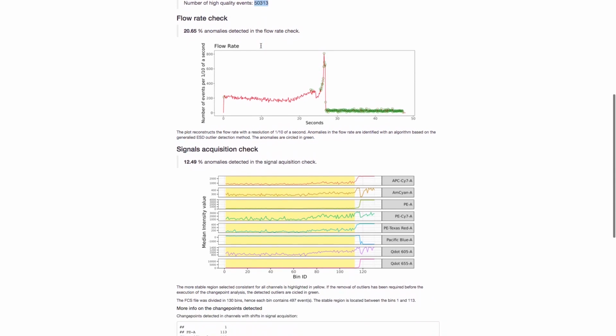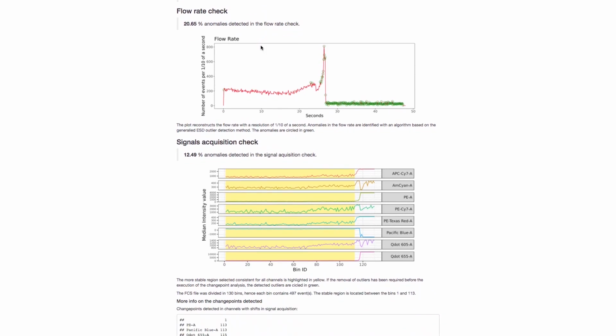We're then going to be looking into each individual method that was used for analyzing these data within Flow AI. We'll point out that every report from Flow AI will always have all 3 anomaly detection methods used and reported, but it's based on your settings which is actually used to formally reject data points. So the information will always be here and will always be reported to you, but it won't always be used to actually reject the events.